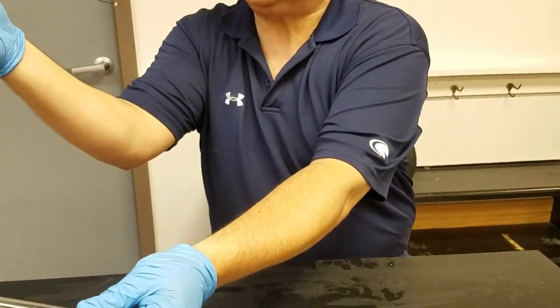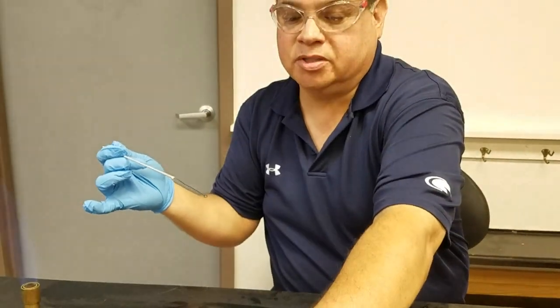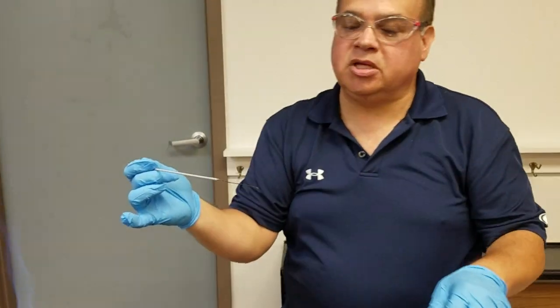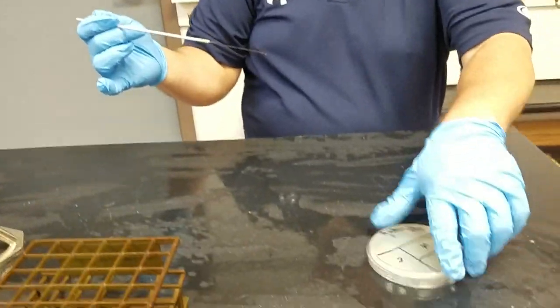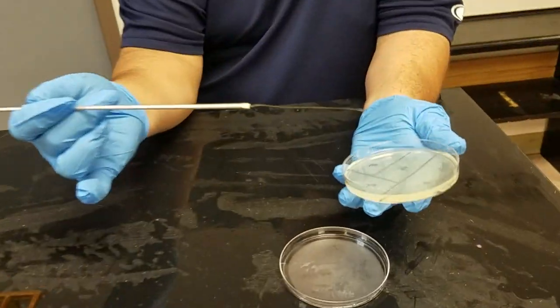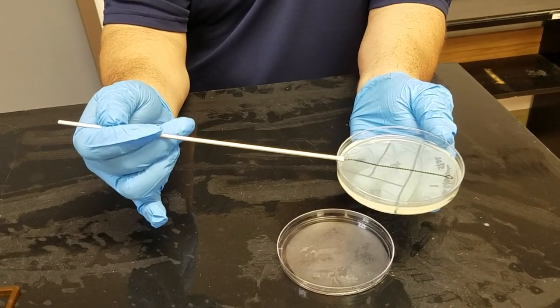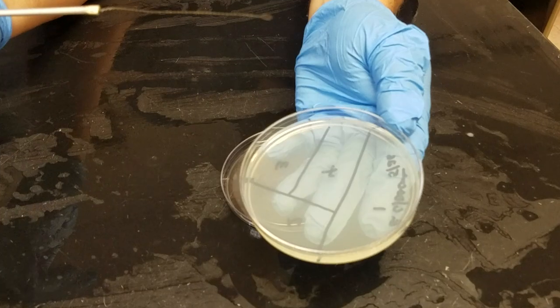In that one drop of suspension, there are millions and millions of microorganisms. This is the only time I'll need to go into that culture. Now I'm going to take the plate and place that one drop of suspension on that first quadrant. You can see it's on there.